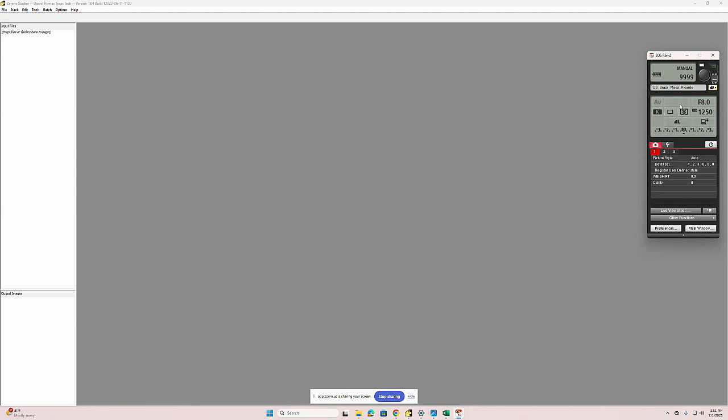Right now you're in AV mode. That's aperture mode. You need to be in manual mode at all times for this. That's a dial on the top of your camera, but you have an R series, so you should be able to control that. So can we control it from here, or do we need to control it from the computer? You should be able to, but for some reason it's not letting you. Can you go to the camera and spin the dial on top, and put it into M mode?